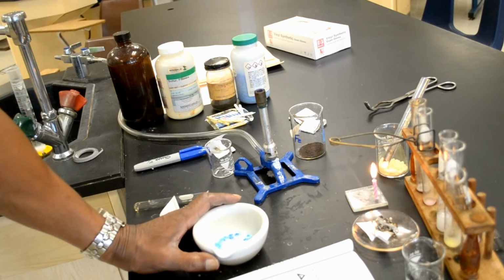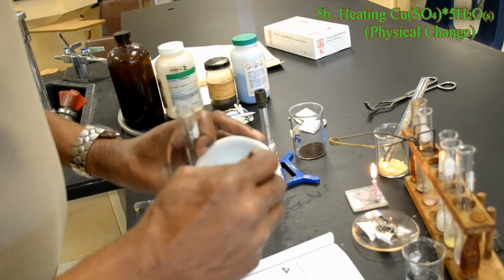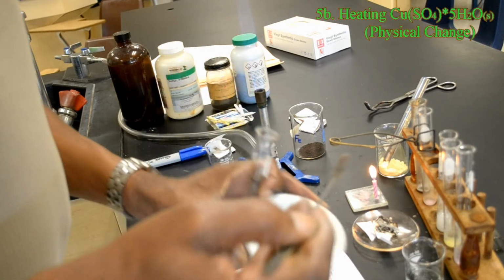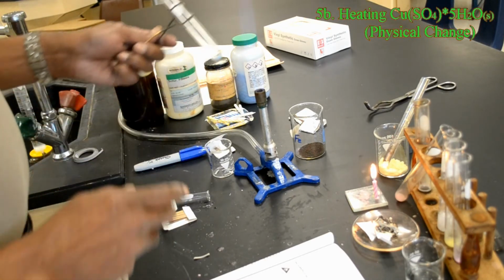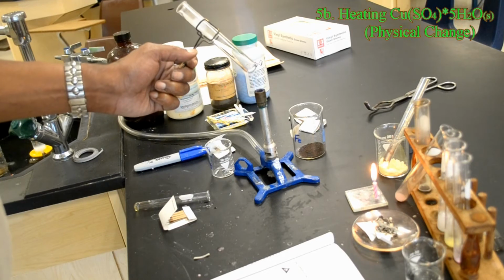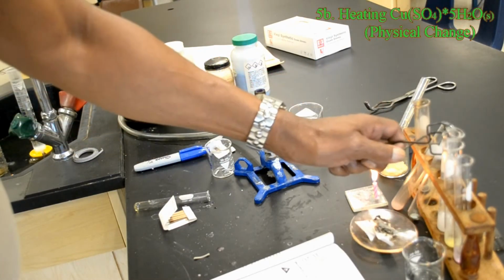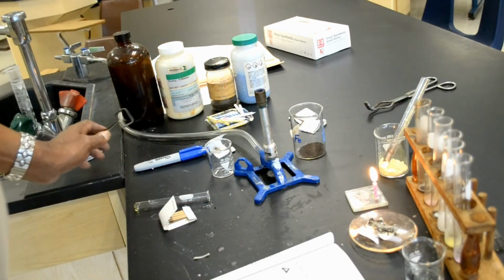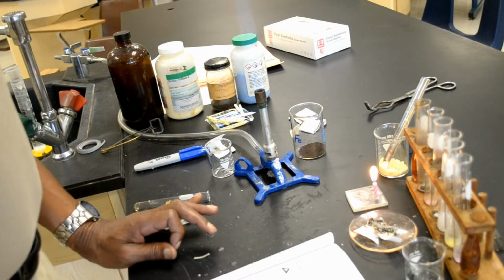Place 1 microspatula of the powder into a test tube. Heat gently over a burner flame for 5 minutes. Allow the sample to cool and then add a few drops of water.